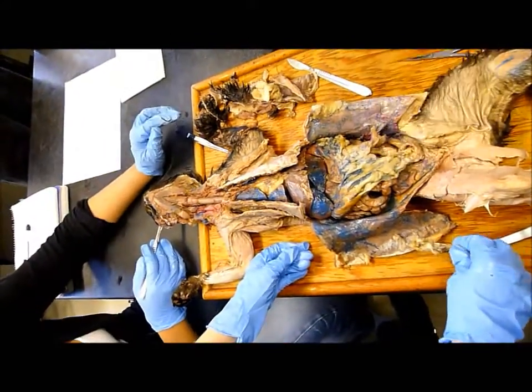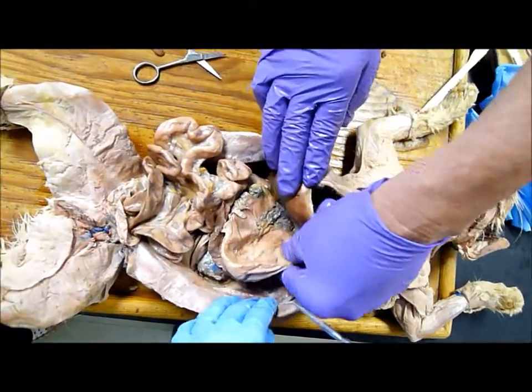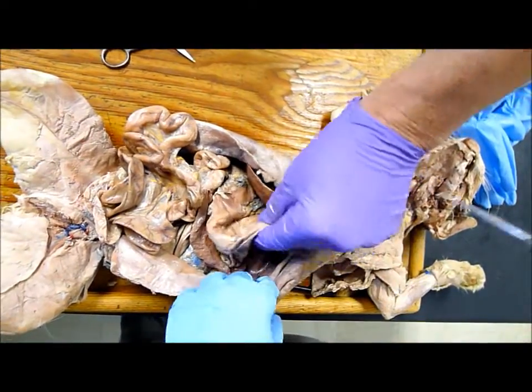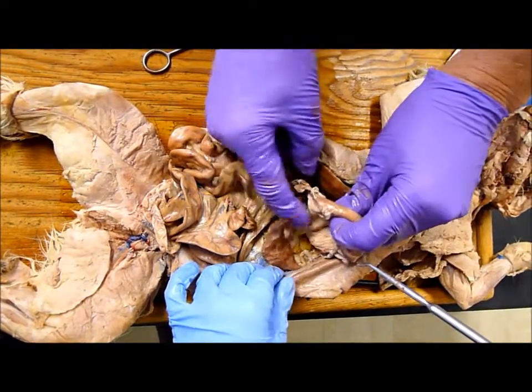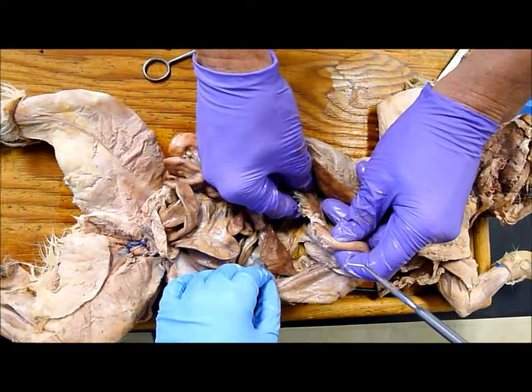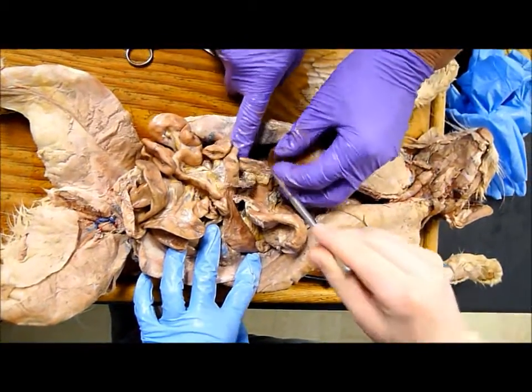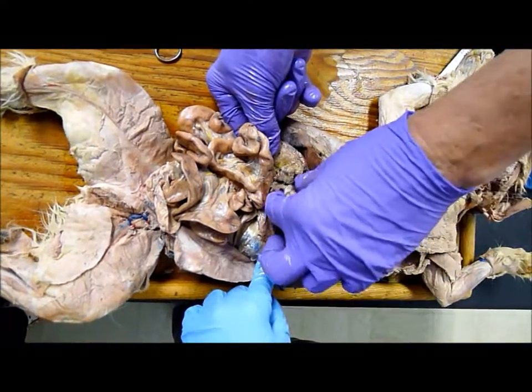Where it bursts out is the cardiac region, right. And then see the part that kind of bulges upward? That's the fundus up in here. Usually you can feel the muscular pyloric valve or sphincter right there — so that's the pyloric valve. And this would be the duodenum, the first part of the small intestine. And that bottom part is the pyloric stomach.